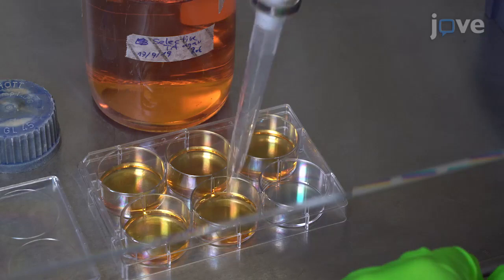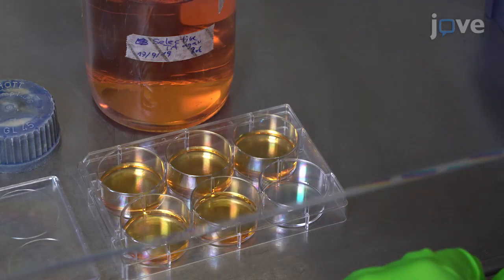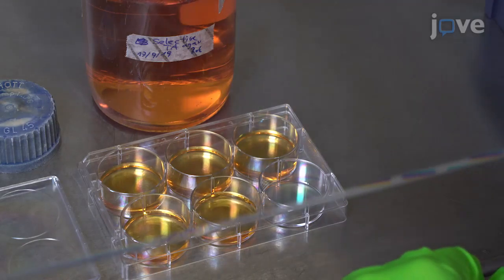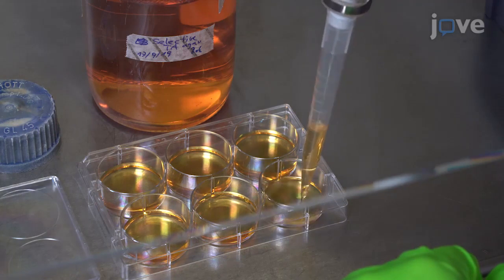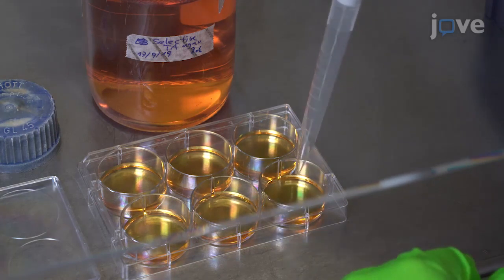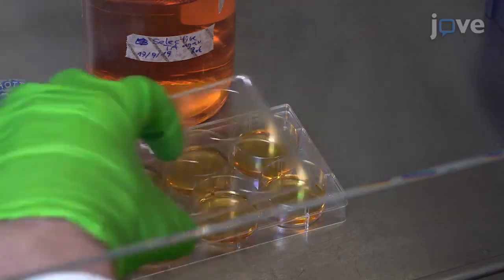The most hazardous reagents used in this protocol are the antibiotic rifampicin and methanol. Make sure to use protective gloves and goggles when rifampicin is dissolved in methanol.